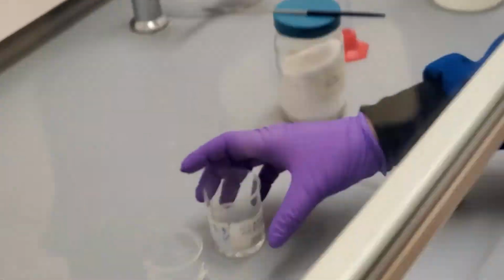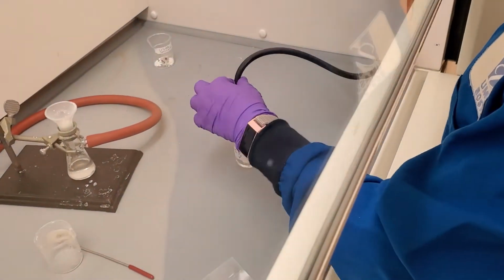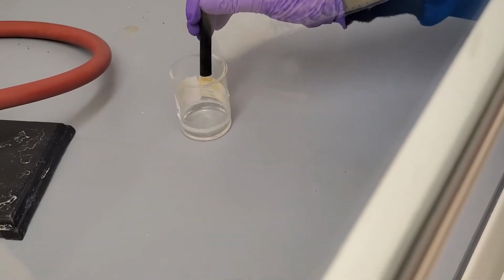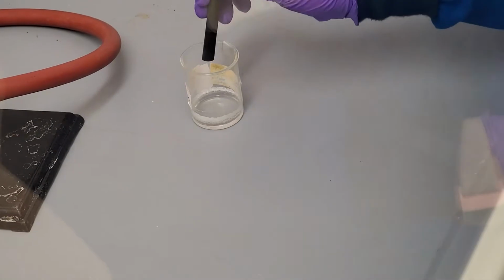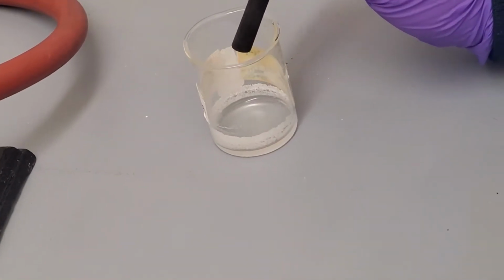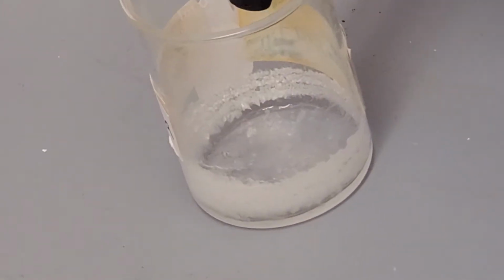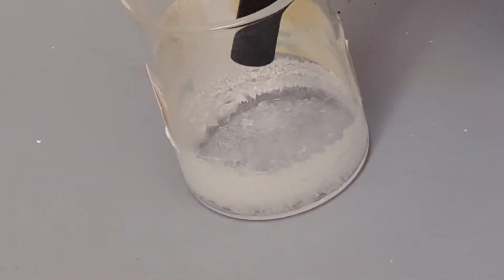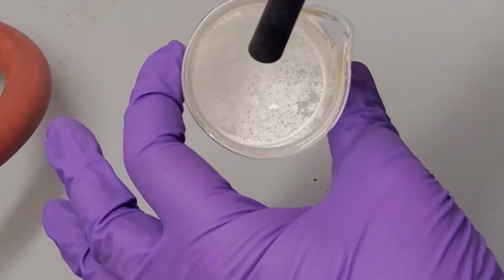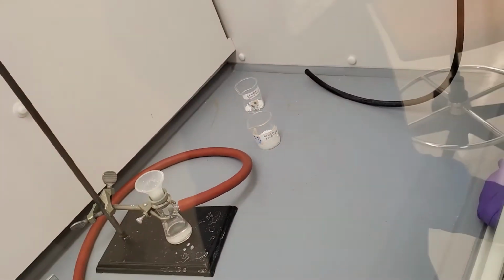Connect the skinny hose to the air nozzle and turn the stream of air on very slowly. You can test the pressure of the stream of air on your gloved hand. Keep the stream of air about an inch above the surface of the ether and let the ether evaporate. Because naphthalene is a very light and flaky solid, we will lightly cover the beaker with parafilm so that any remaining ether can evaporate overnight, but it will prevent the hood from sucking up the crude naphthalene.